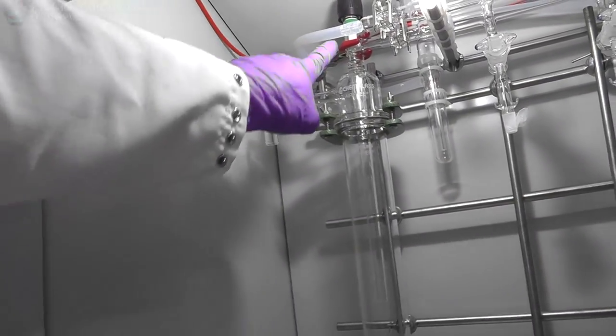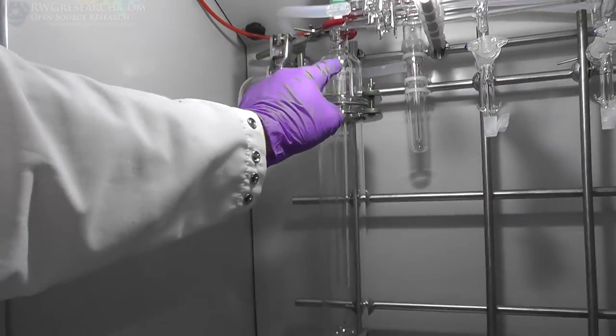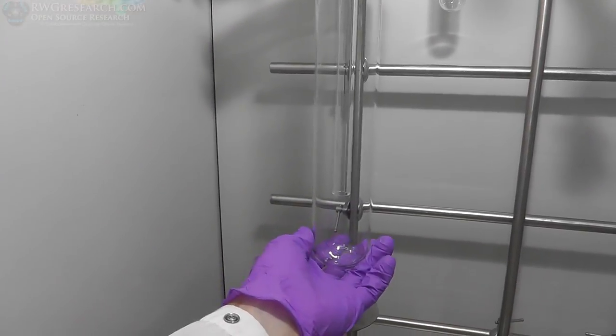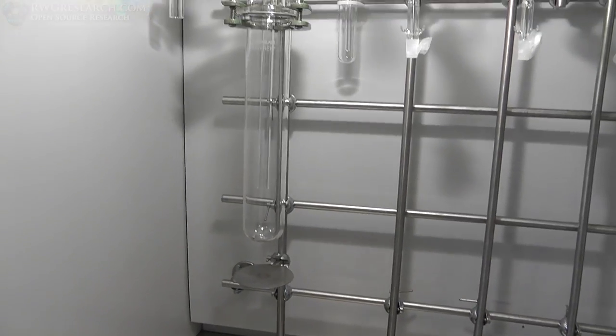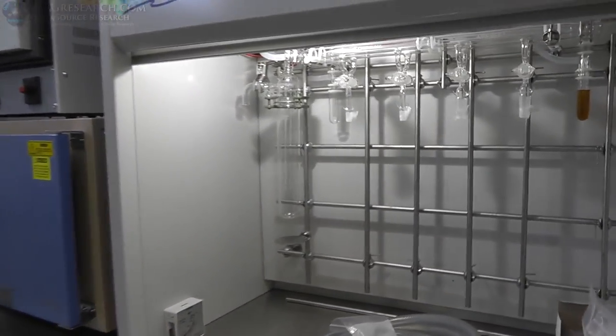Also, I just added this clamp up here. So you can see, it's a bit tight, but that holds this guy, so now I don't have to have that support under there. So anyway, I had to mention those things. That's from what I did from last time.